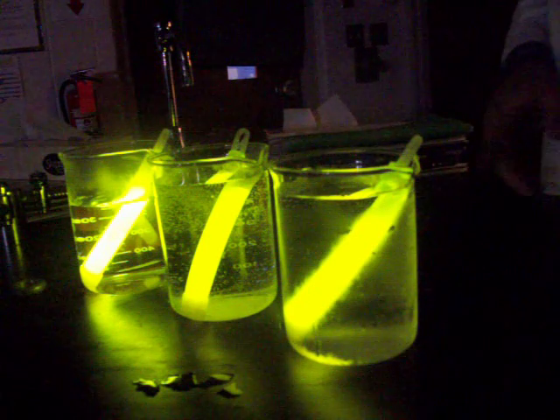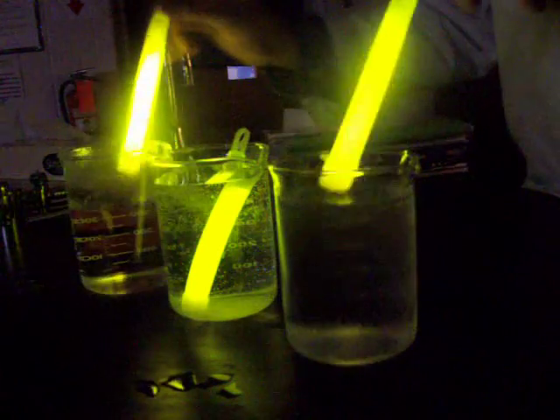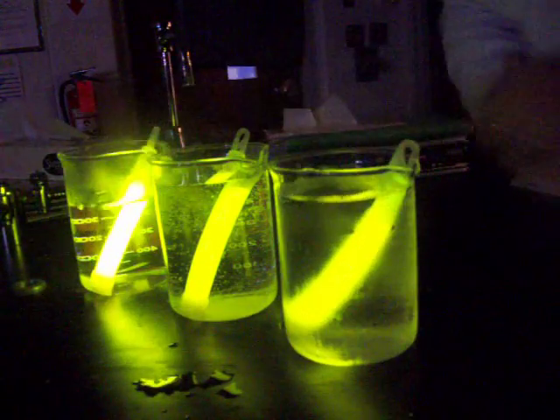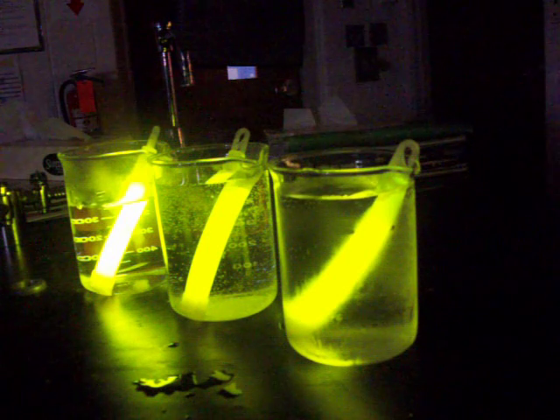And already, you should begin to notice a difference between the two. And if I pull them out here for you to see, you might notice a bit of a difference in brightness here.